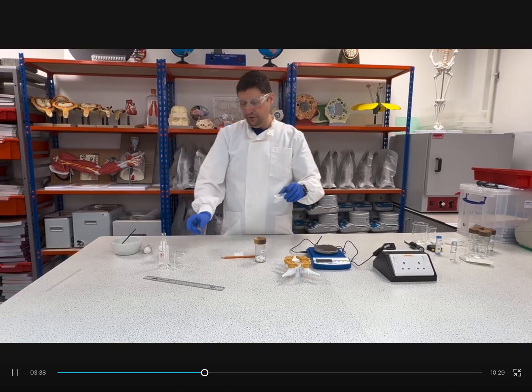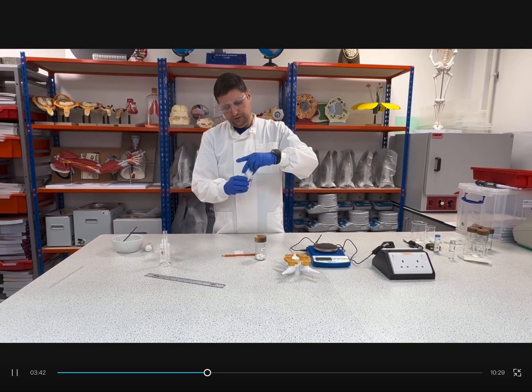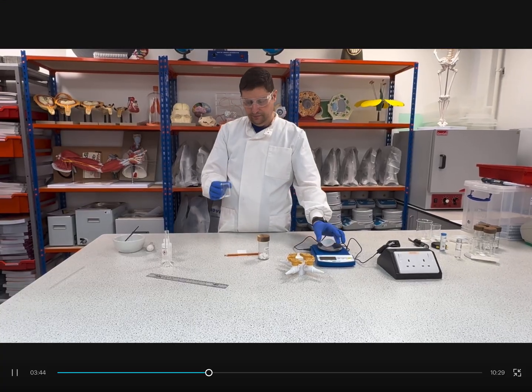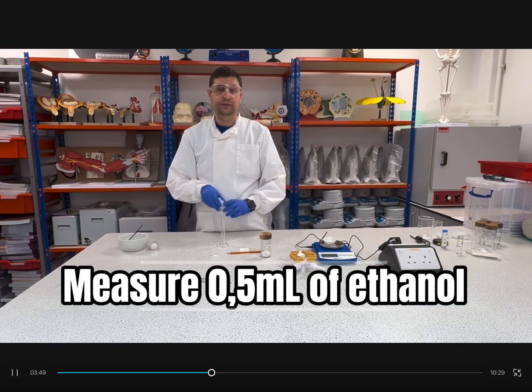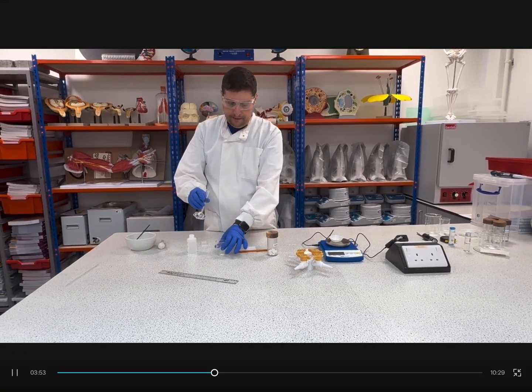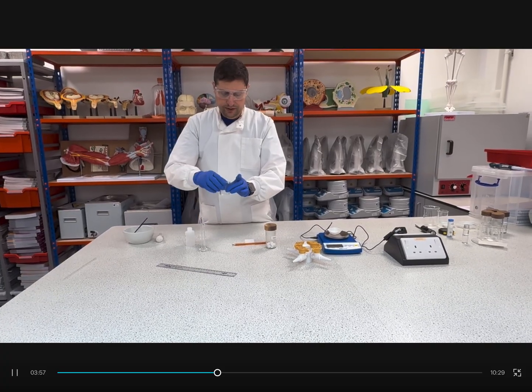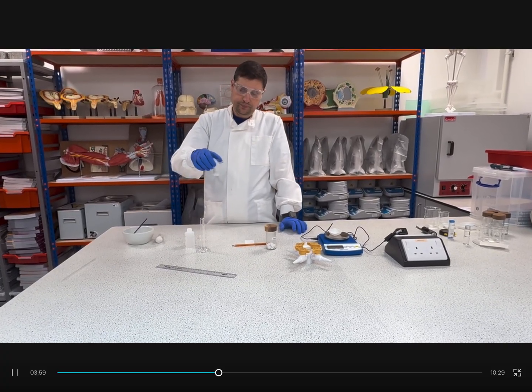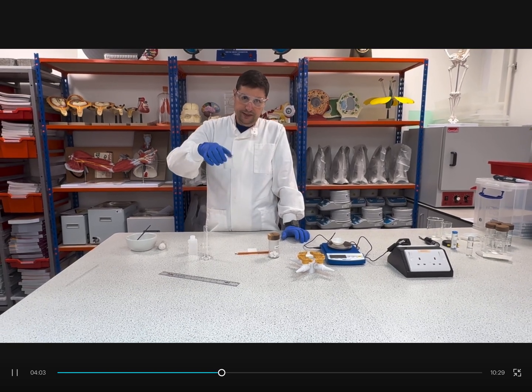I will take my sample and transfer it to a beaker and measure 0.5 ml of ethanol. Transfer the ethanol to my beaker and shake until you see this is dissolved.